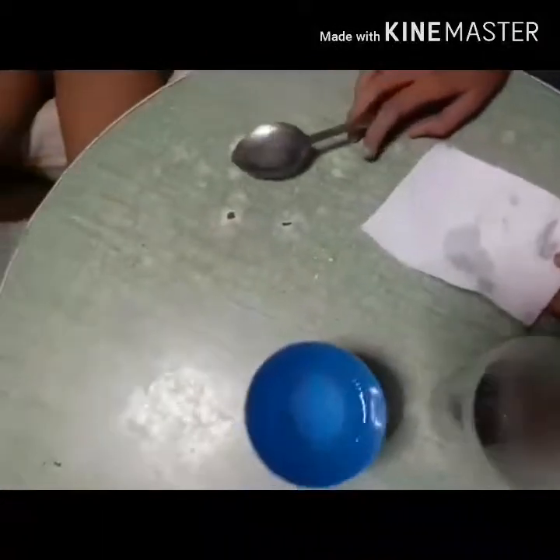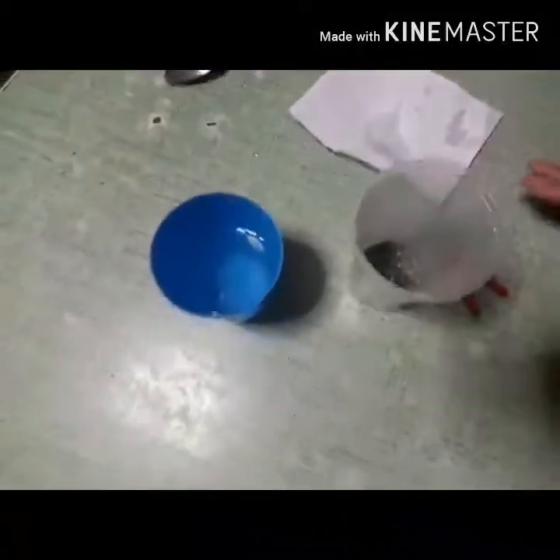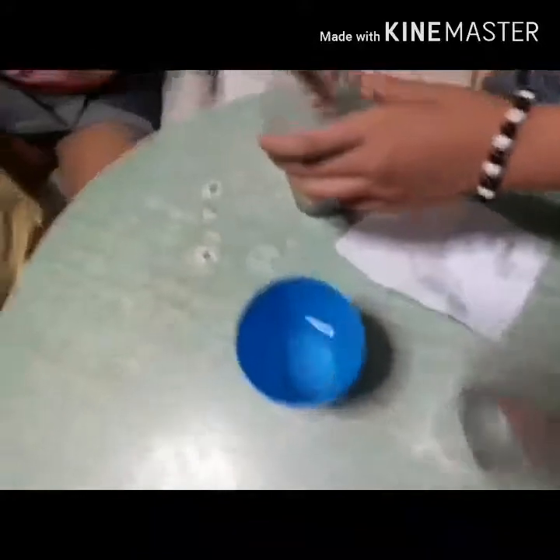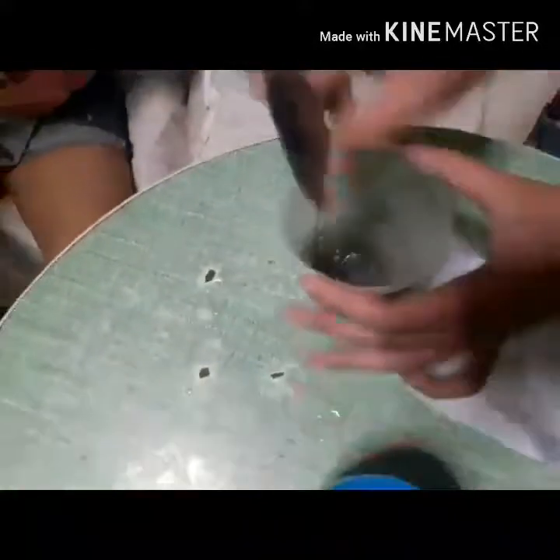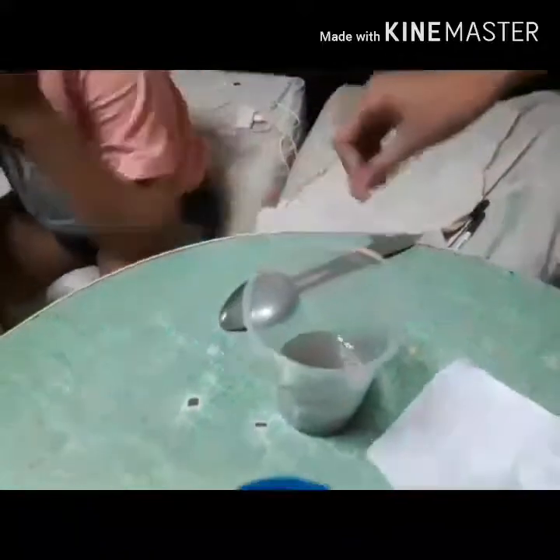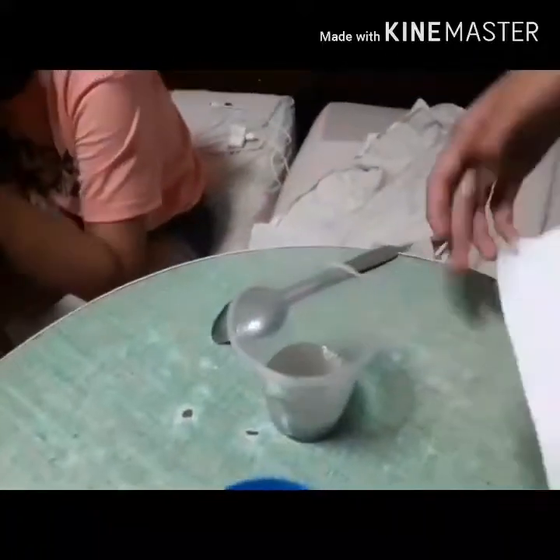First, we're going to mix sand and water. Next, we're going to form the paper filter into a cone shape.